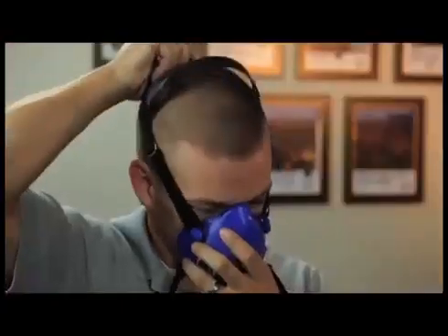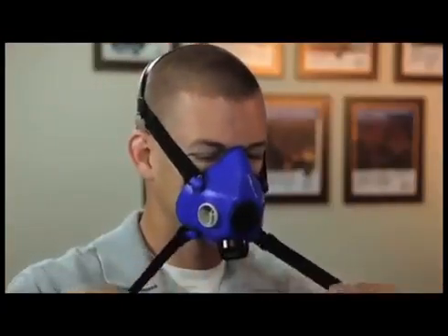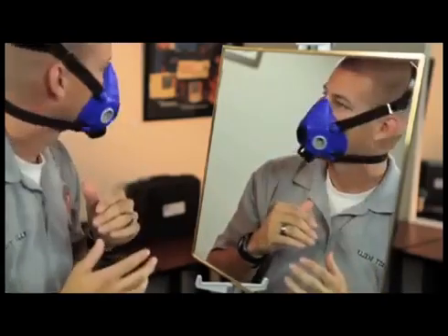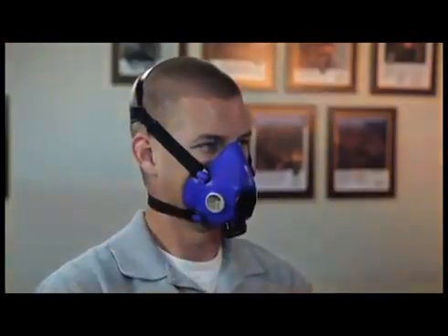Have the subject select several respirators and hold each one up to their face. Let them don and wear their favorite for 5 minutes to determine its comfort. If the subject is unfamiliar with the respirator, have them don it several times to become adept at setting the proper tension on the straps.